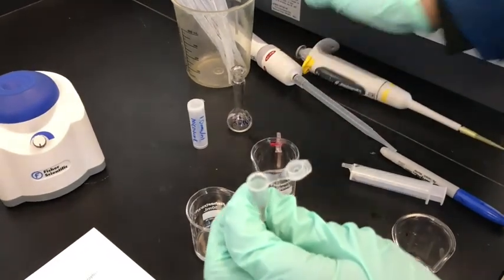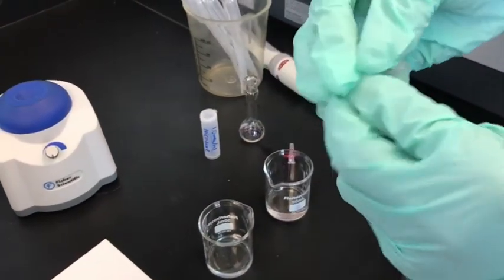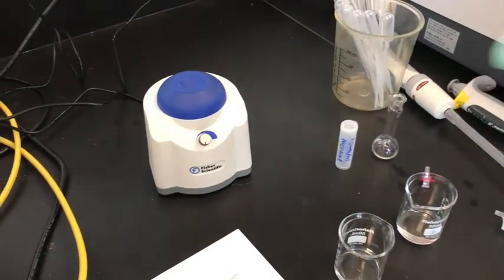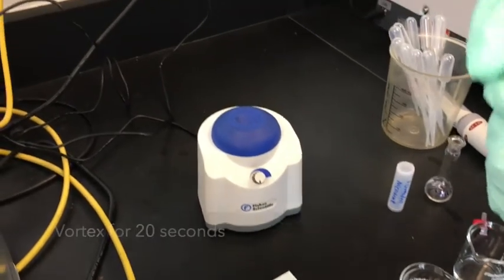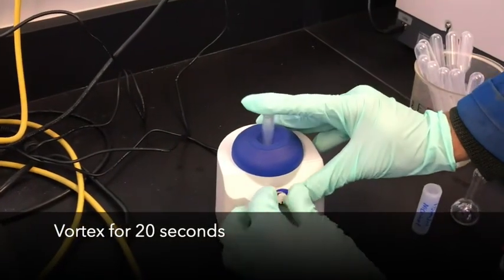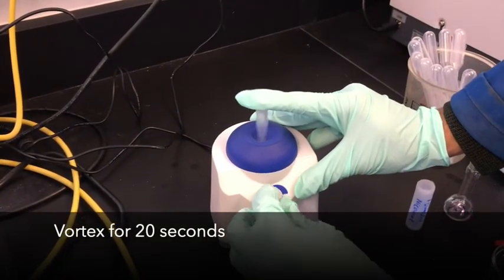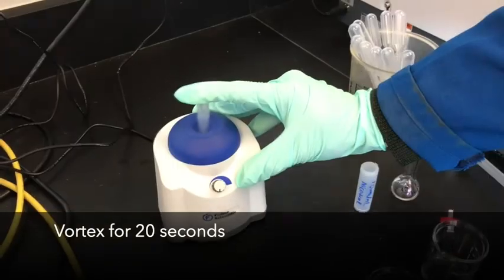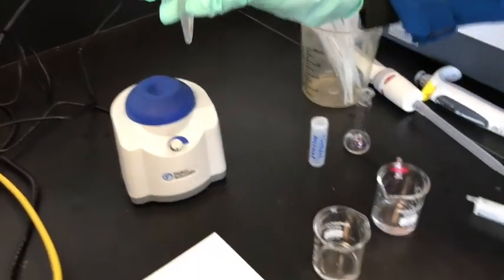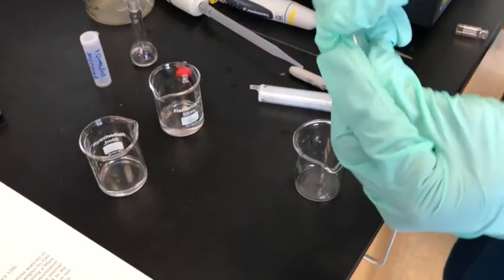Close the top and vortex for about half a minute, or 10 to 20 seconds. Once we have done vortexing, we can transfer that into another beaker.